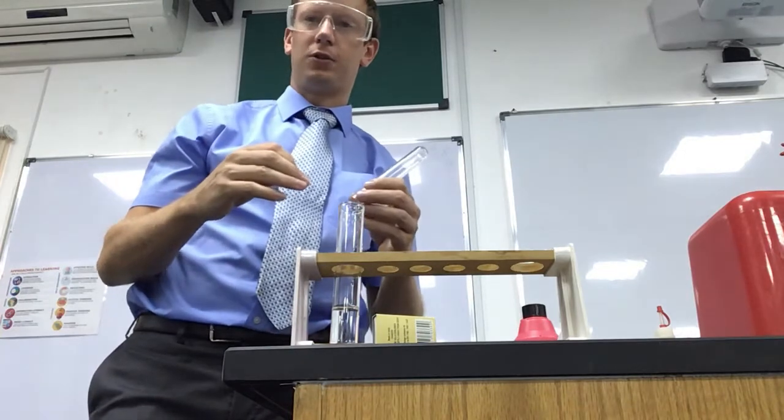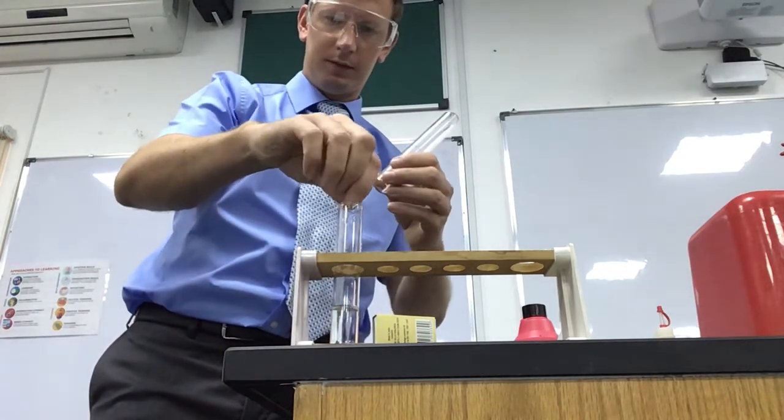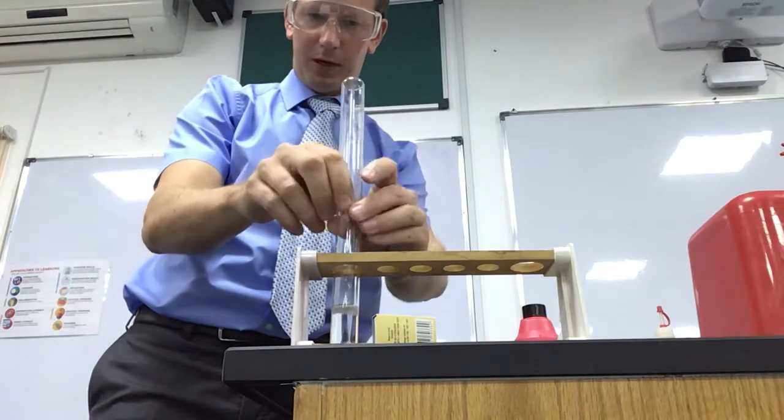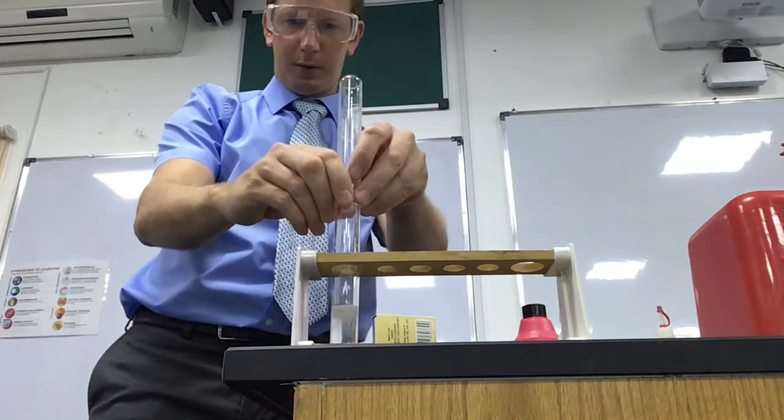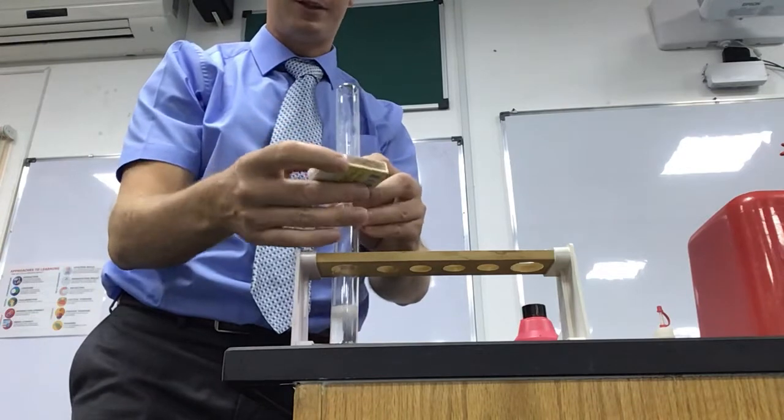I can see it bubbling away. A little stir. Bubble, bubble, bubble. While that's bubbling away I'm going to light myself a splint.